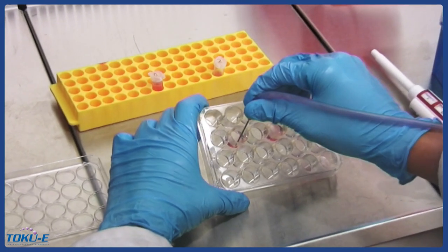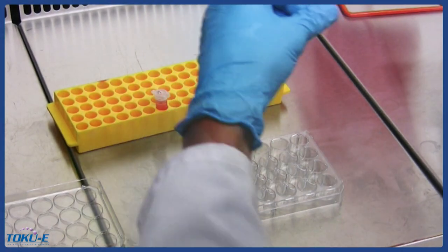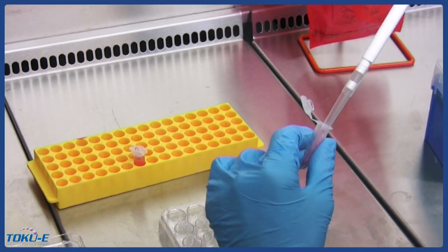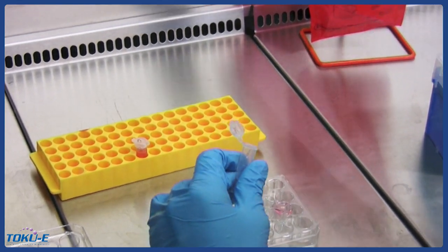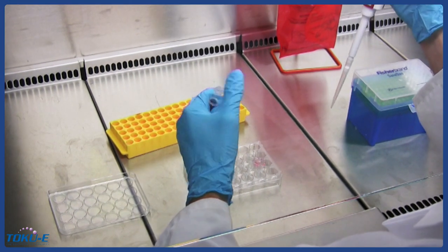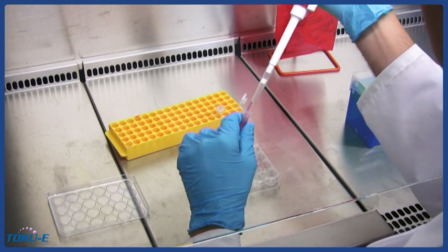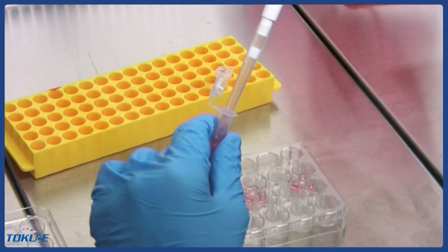After 24 hours of incubation, remove the medium from each of the three wells and add normal culture medium to one of the two non-transfected wells to serve as a negative control. Add freshly prepared selection medium containing the minimum concentration of selection antibiotic as determined by the kill curve step to the transfected well and the remaining positive control well.